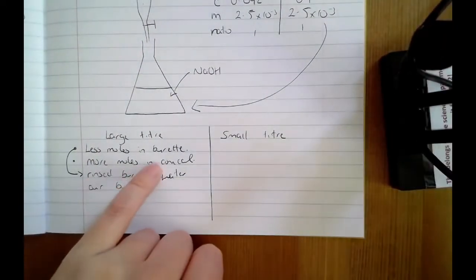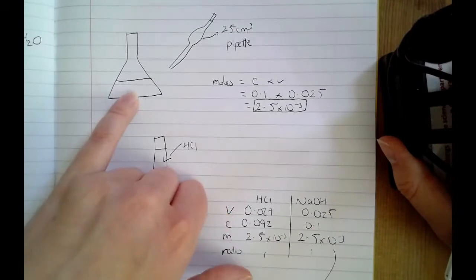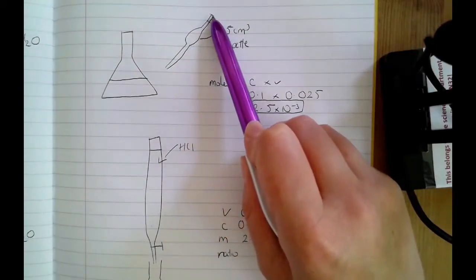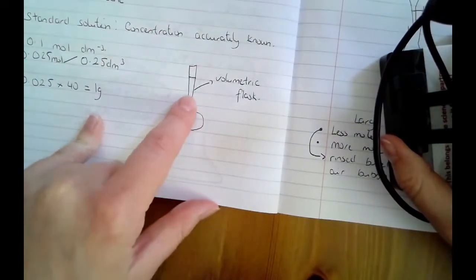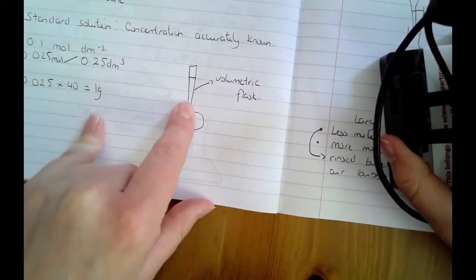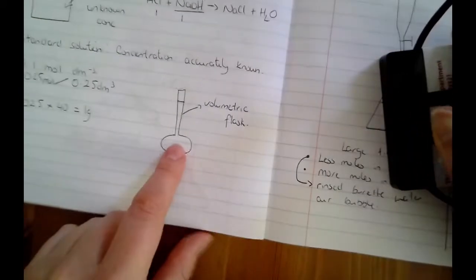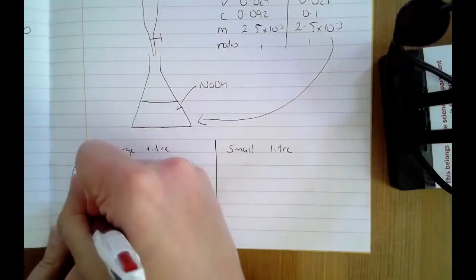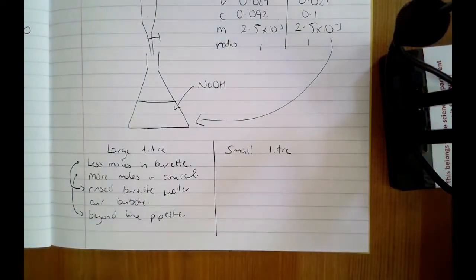The other thing here would be that you have more moles in your conical flask than you intended. Whatever you've measured in your conical flask was too concentrated. An error with that would be if you used your pipette incorrectly. If you went above the 25 centimetres cubed line, you would be adding more to that conical flask than you intended. Another thing here, when you made up the volumetric flask in the first place, if you didn't bring the water right up to the line, then you've got a more concentrated solution than expected. That will cause you to have more moles in your conical flask if what's in your conical flask was your standard solution. So going beyond the line with your pipette would give you more moles in your conical flask.